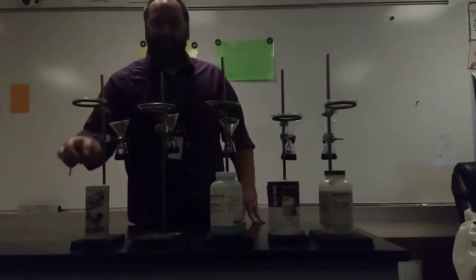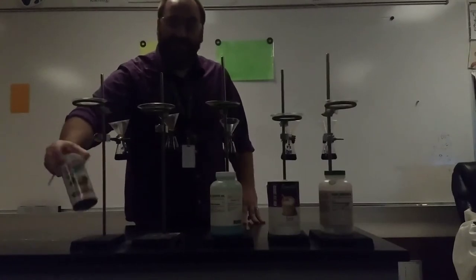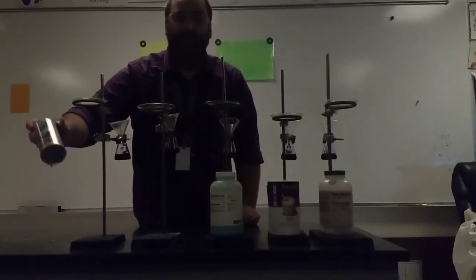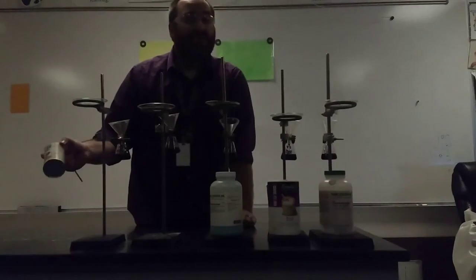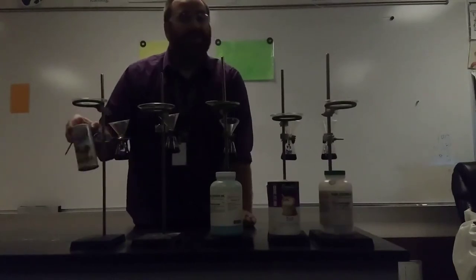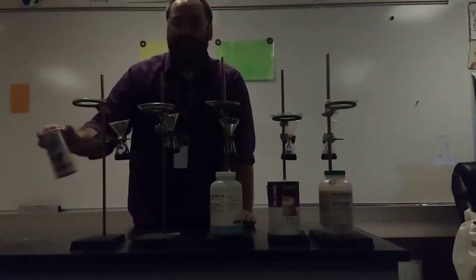And finally at the very end, this is a substance called no salt. Similar to table salt, no salt is an edible salt, but this salt is made out of potassium chloride instead of sodium chloride.